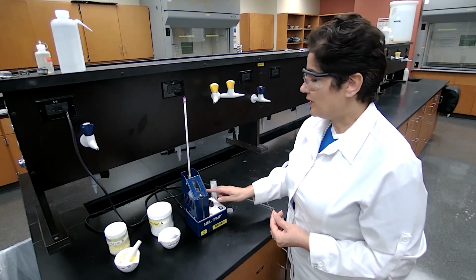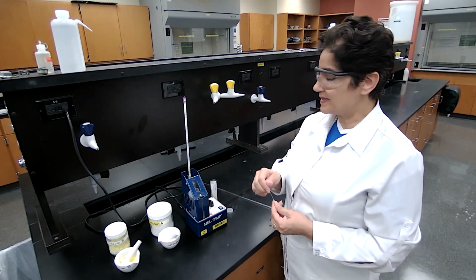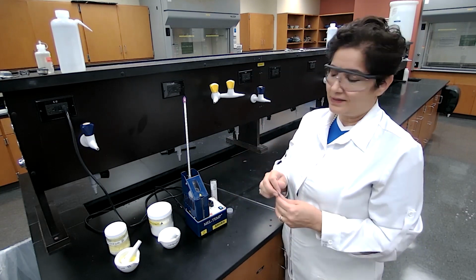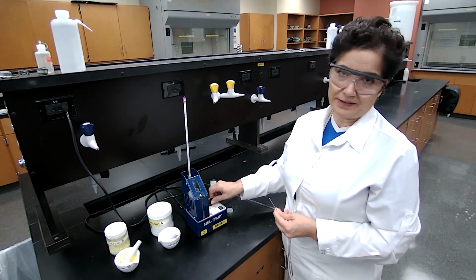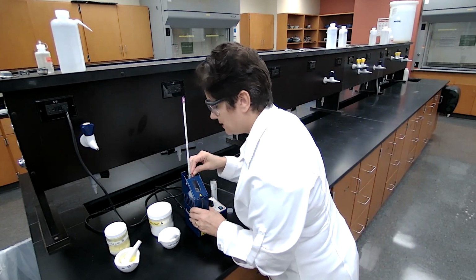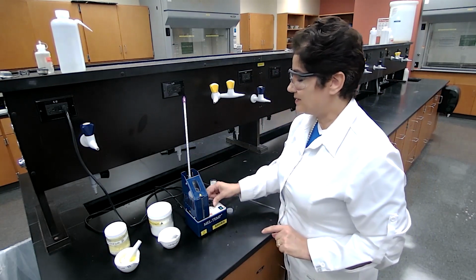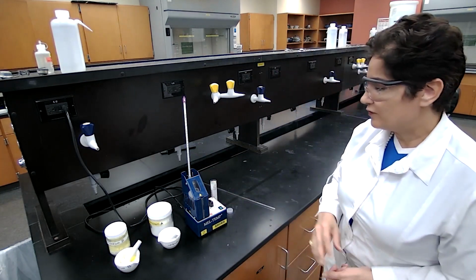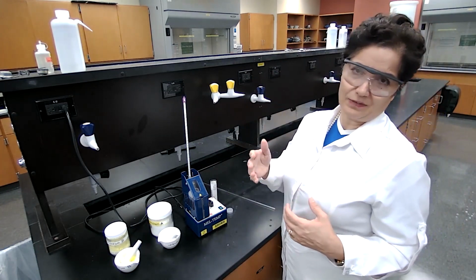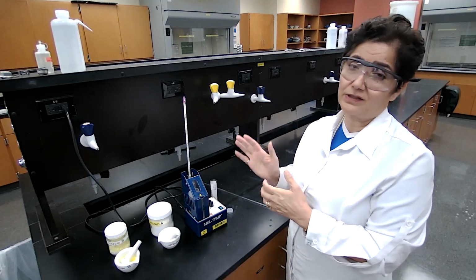So I'm going to set it between 4 and 5, but if it melts at 100 or less, then I'm going to do a second sample and set it between 2 and 3. To place it in the sample holder, turn on the machine and set it between 4 and 5. 4 and 5 on the chart is anywhere between 100 to 150.